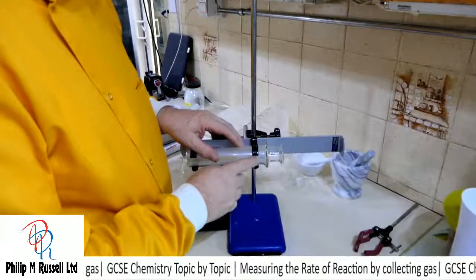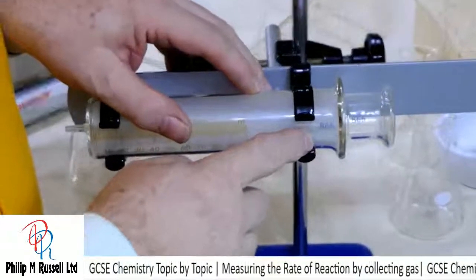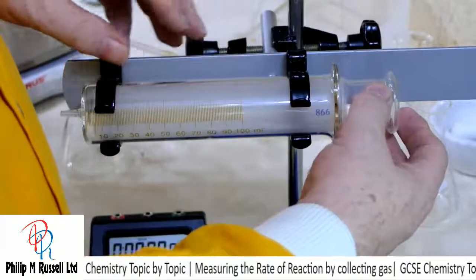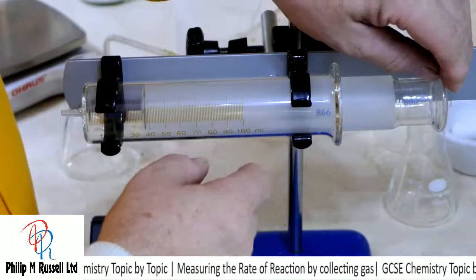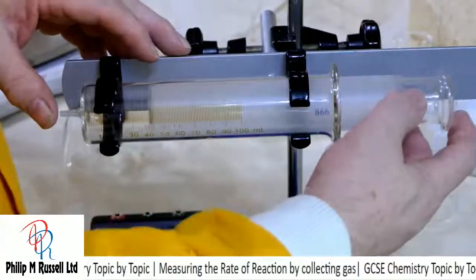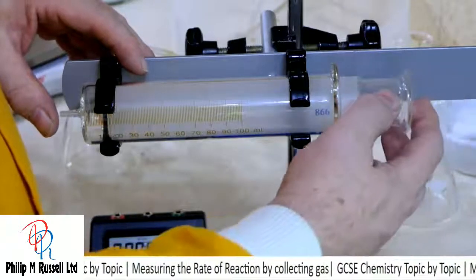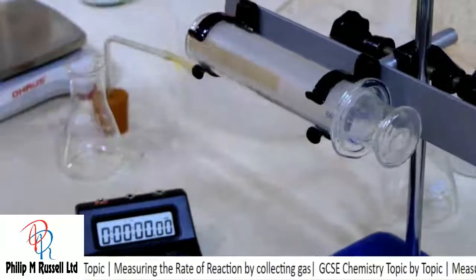The way these are made, they're matched, and you might see here the numbers, and if we zoom in for a minute we should be able to see that it's got a set of numbers, 866 here and 866 there. So these are literally matched, so this makes an airtight joint. This is ground glass, and that exactly fits in there, and if we put some air in then this will move. So an airtight gas syringe.